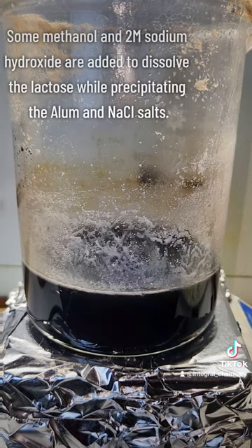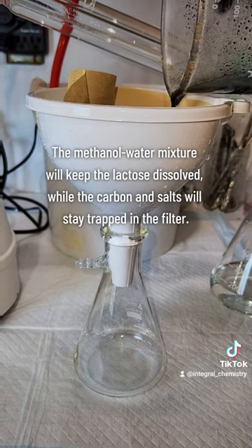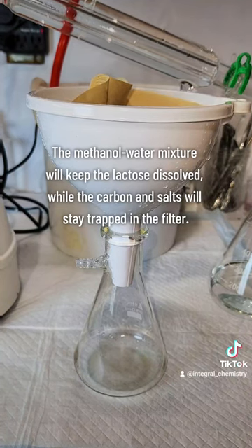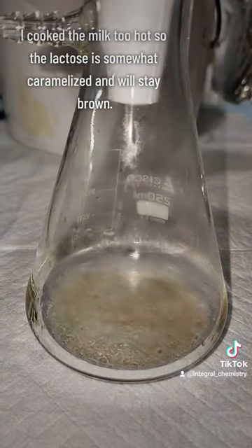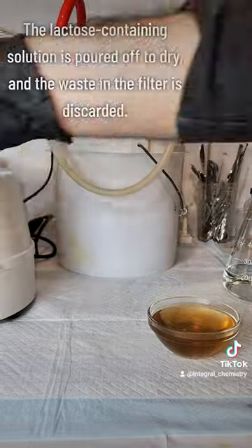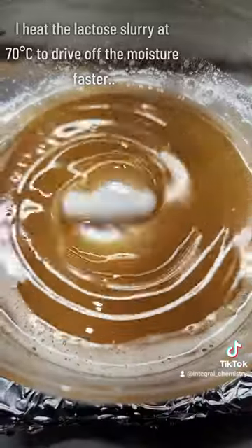As a final step, I add some 2 molar sodium hydroxide and some methanol, and this serves two purposes. The hydroxide will form 3 salts that are insoluble in this already saturated solution — these include aluminum hydroxide, sodium chloride, and sodium sulfate. The methanol will mix with the water and create a solution that can dissolve the milk sugar without dissolving the salts. This milk sugar is called lactose, and it's the last component I want to separate here. I filter off the carbon and salts, and I'm left with this brownish solution of lactose.